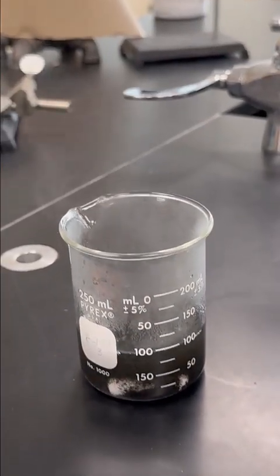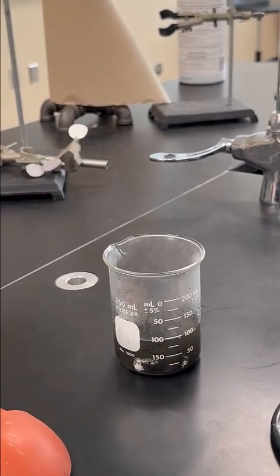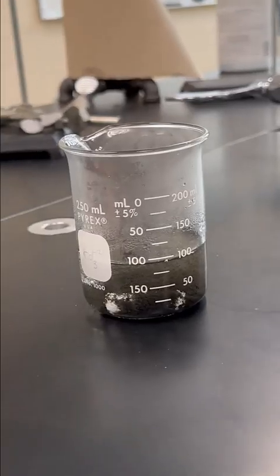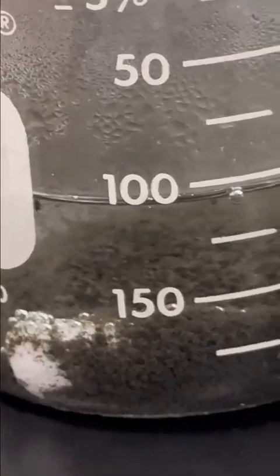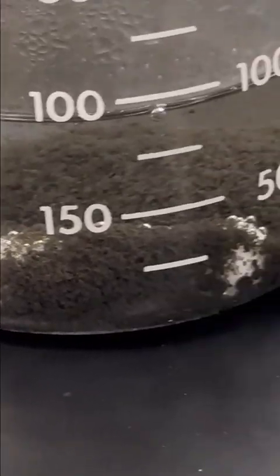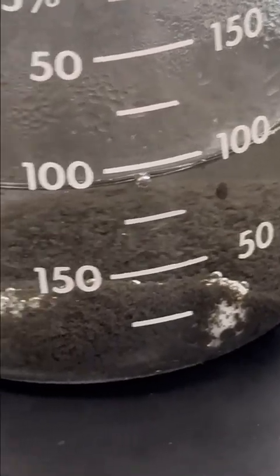All right. And we just need to remove that stir rod, and then we'll let the sample settle out of solution. So you can see again all those black particles. You can see that solid precipitate. That is your copper oxide. So it has changed form again.